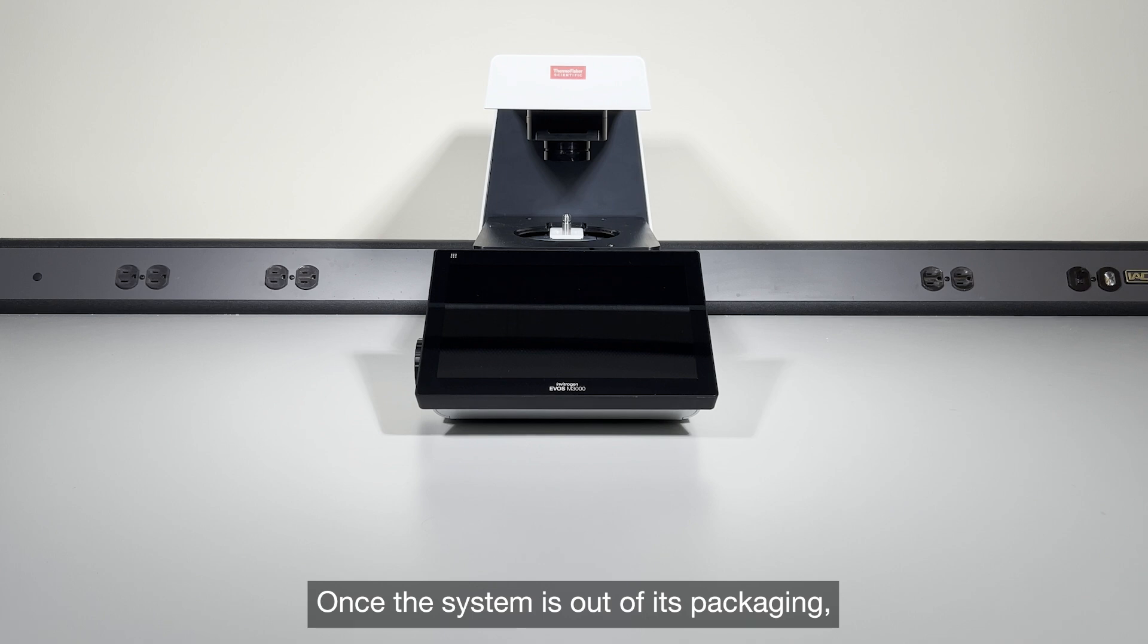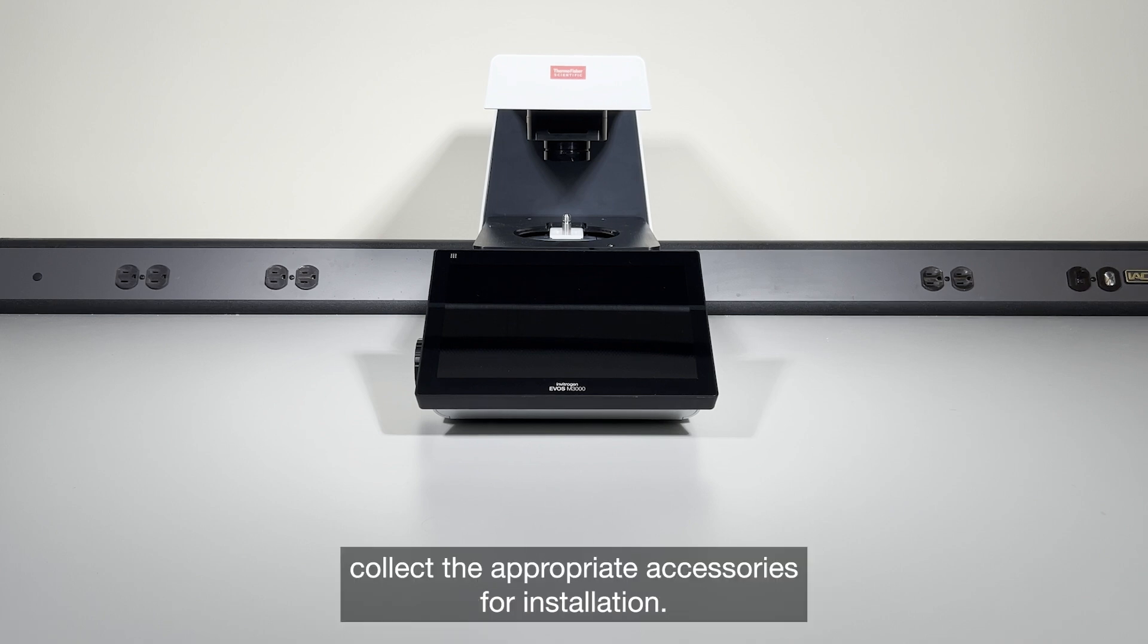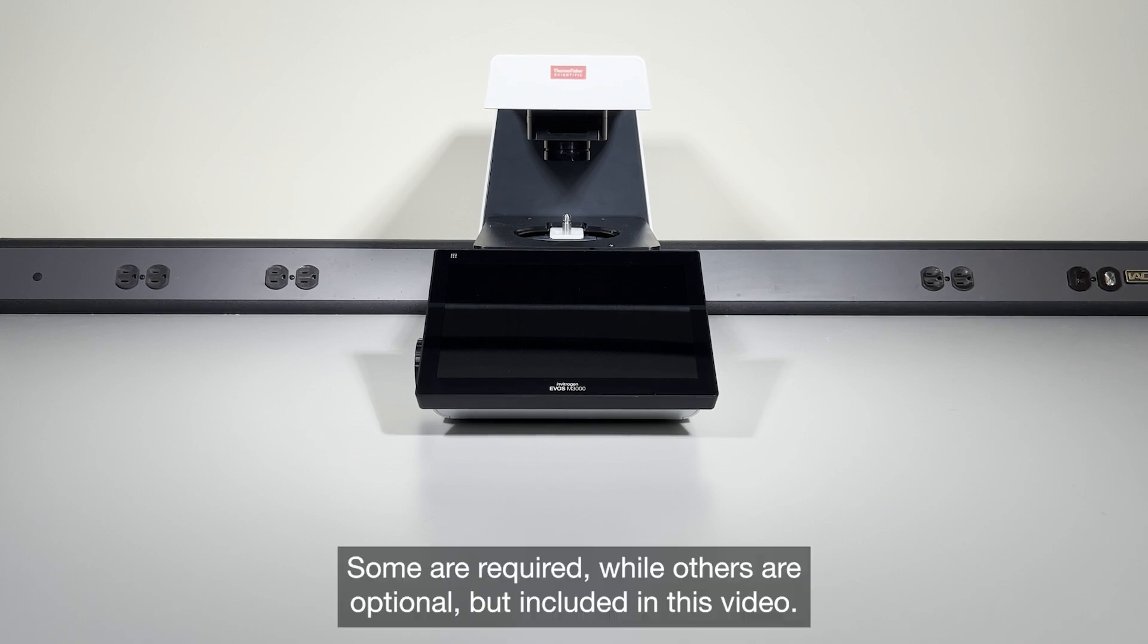Once the system is out of its packaging, collect the appropriate accessories for installation. Some are required while others are optional but included in this video.